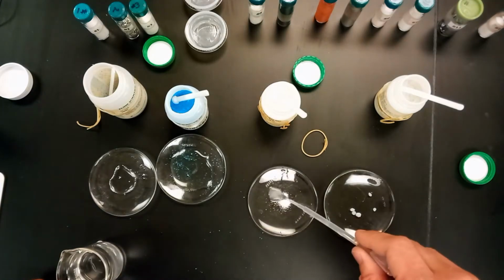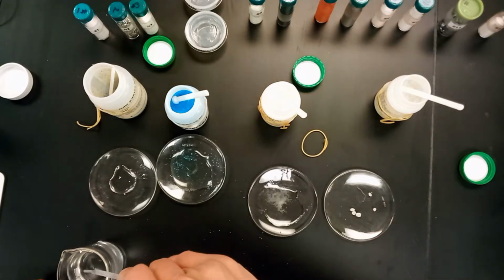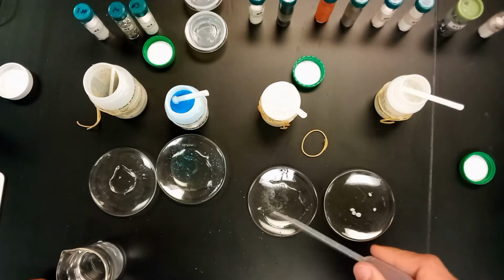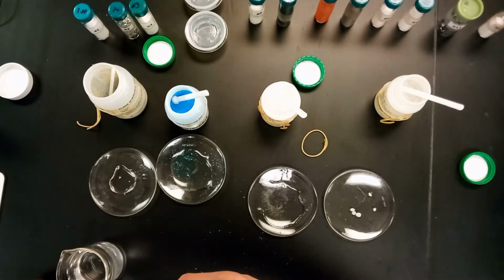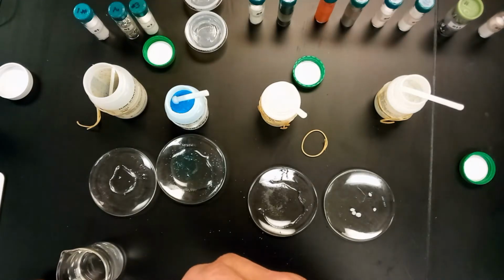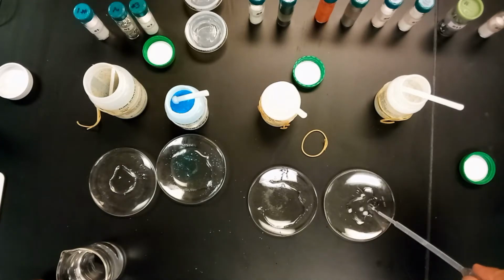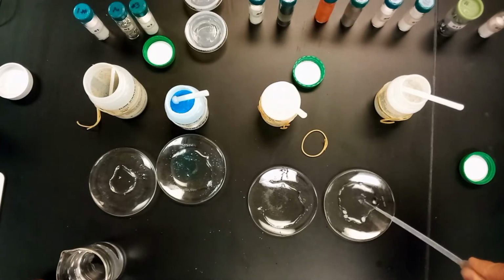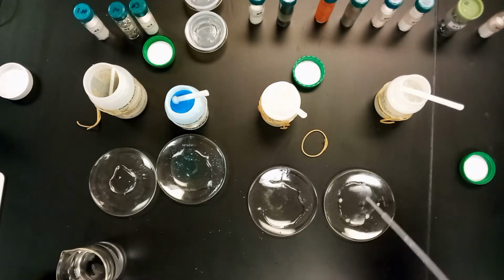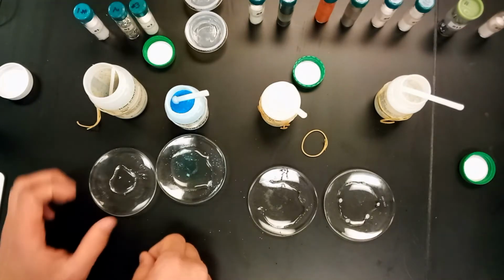We'll just let that sit for a little bit. Add it to the dextrose as well. Again, this is kind of familiar territory. If you've ever made Kool-Aid, you've seen that sugar dissolves in water. So, again, when we let that sit for a little bit, probably will notice that. And here with paraffin wax, kind of as you might expect with putting wax in water, probably not going to dissolve there. So we'll let this sit for a little bit, and we'll come back to it.